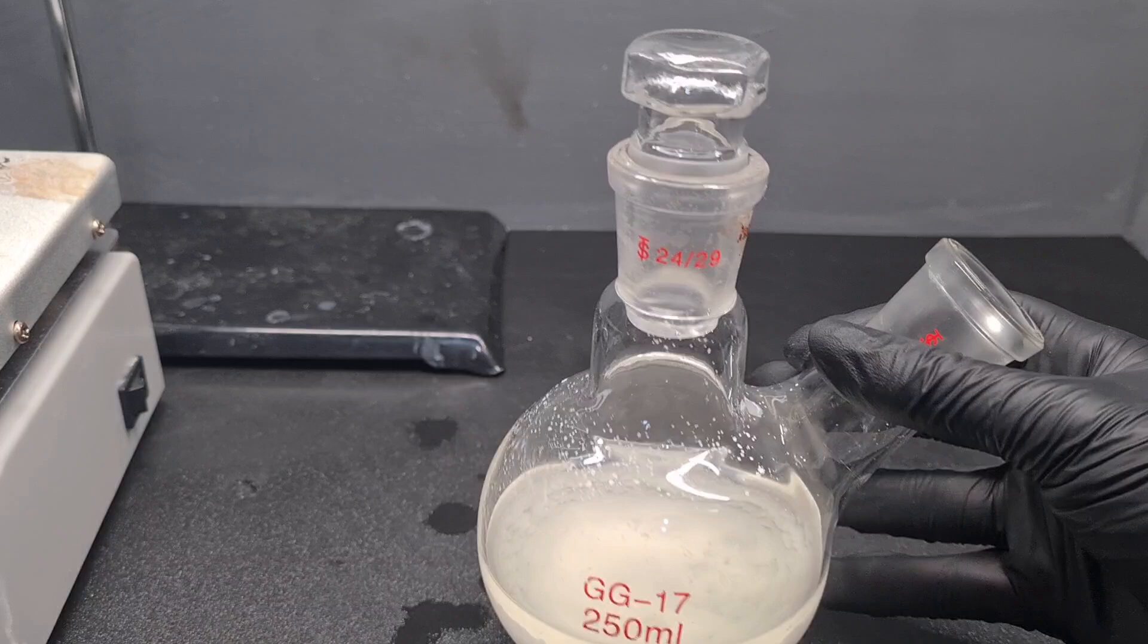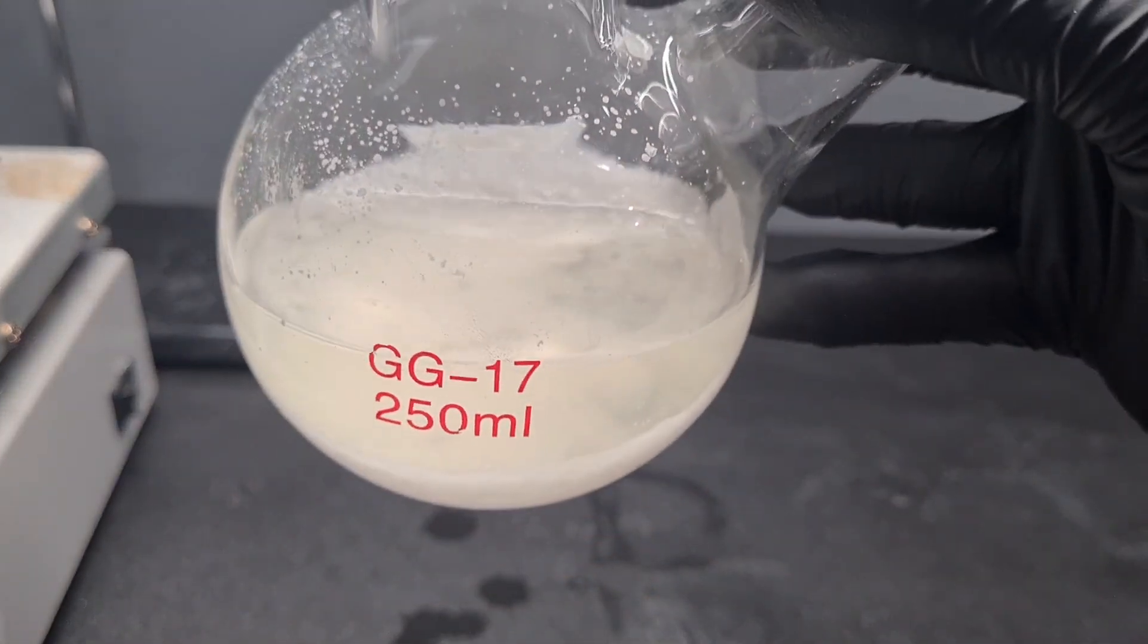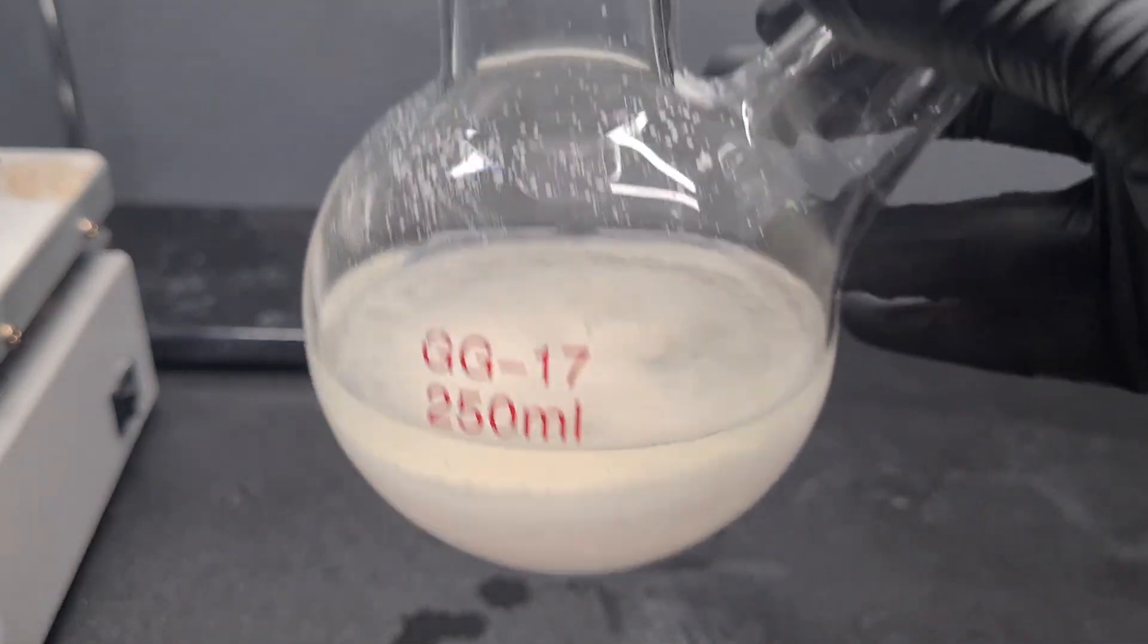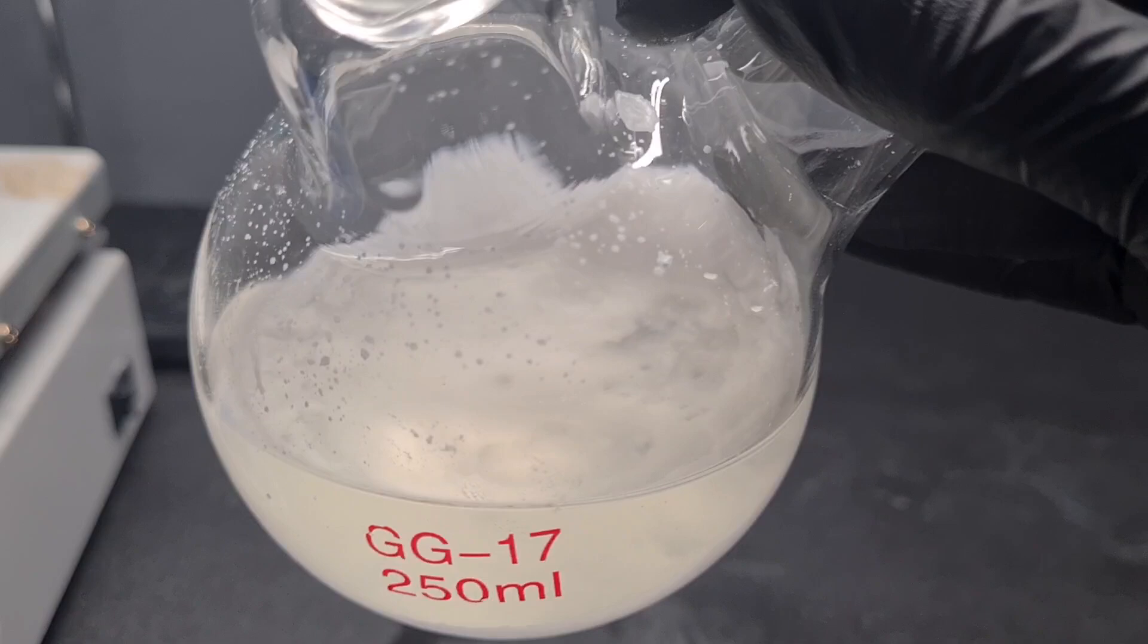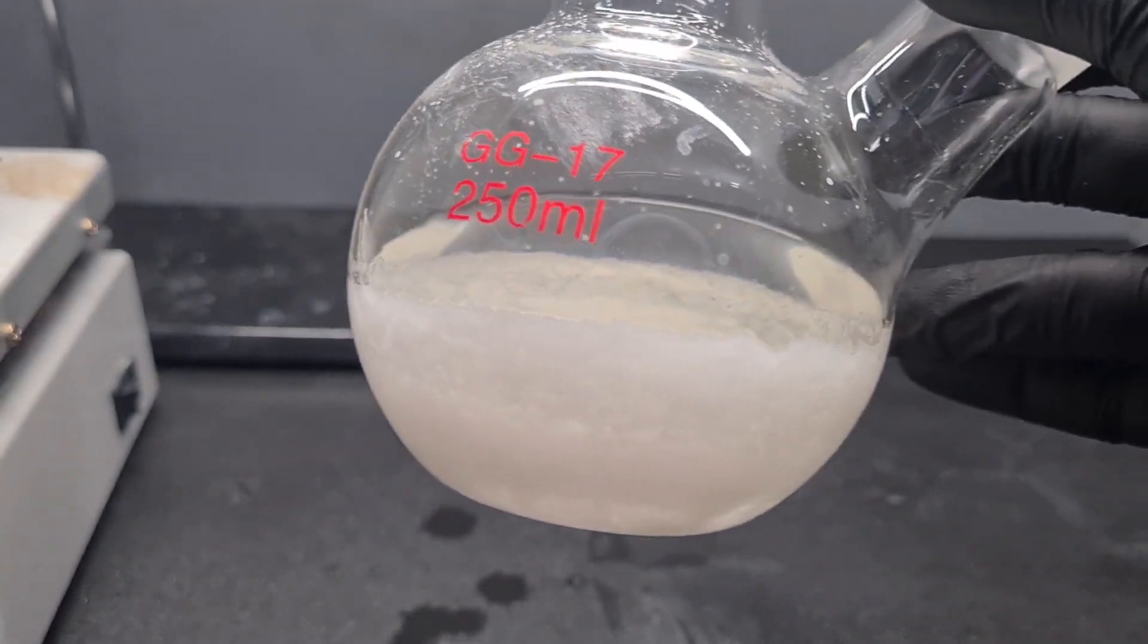And as for the reaction flask, we're left with a cake of sodium carbonate and water. I'm sure this will be fun to clean.